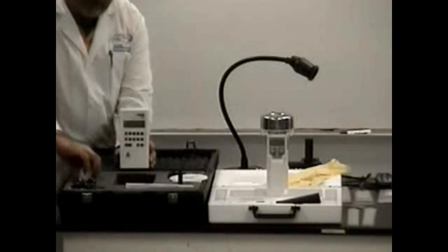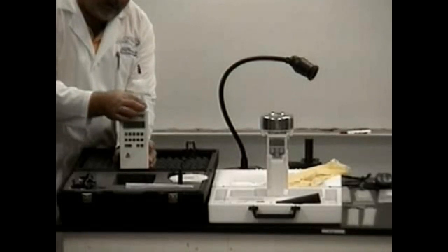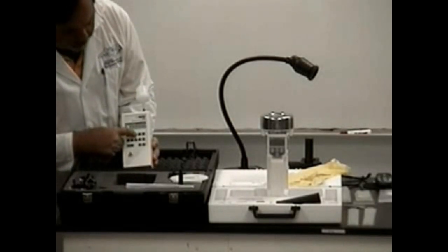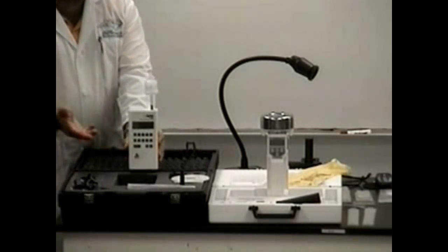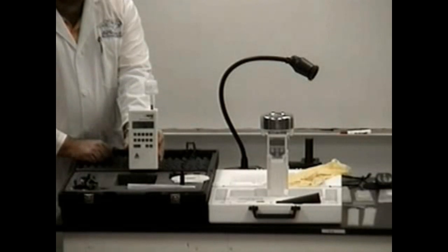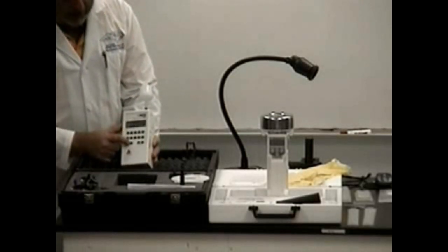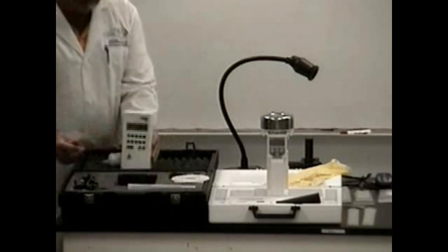This is our particle counter. I'm going to screw the filter onto it first, remove the cap, and turn the power on. I'll set it at whatever particle size I'm interested in—it's simply a matter of pressing the start button. I can let it run for one minute and it will collect one-tenth of a cubic foot of air through this filter, then extrapolate that data since I have it set to cubic feet per minute. Whatever the count is through that filter should be fairly low. Now I'm going to stop it.